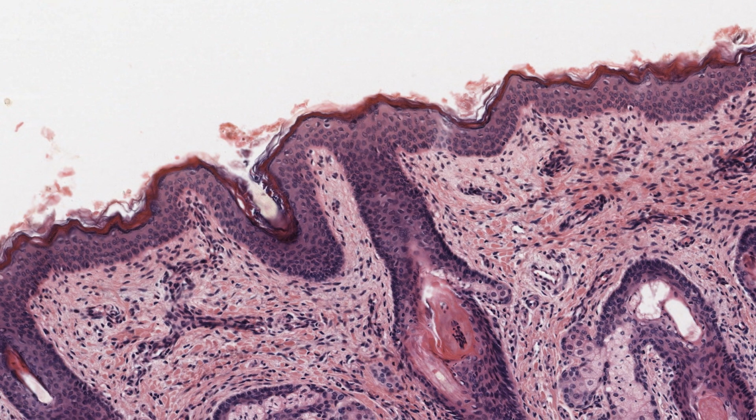New cells are continually added to the bottom of the layer of keratin, and packets of keratinized cells continually flake off the surface. Think of dandruff. The basal layers of cells of keratinized stratified squamous epithelium look similar to their counterparts in unkeratinized stratified squamous epithelium. Only the upper layers are distinctive.